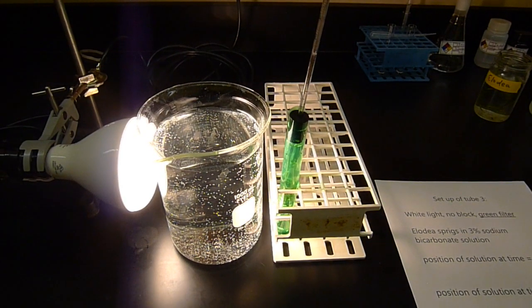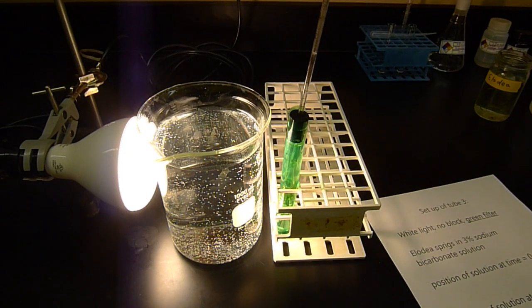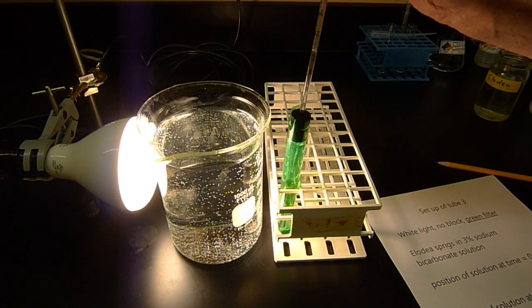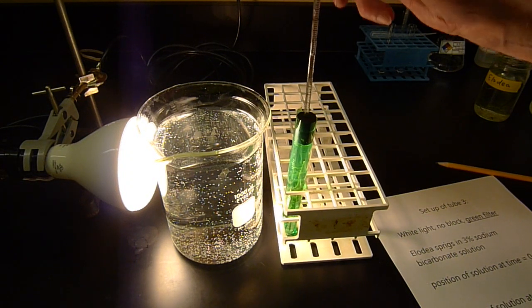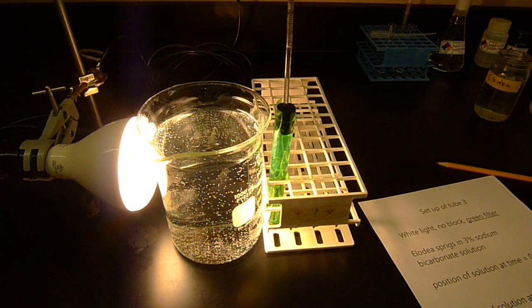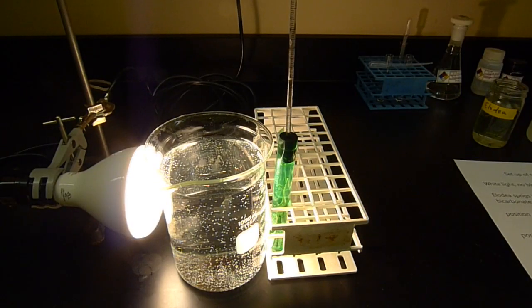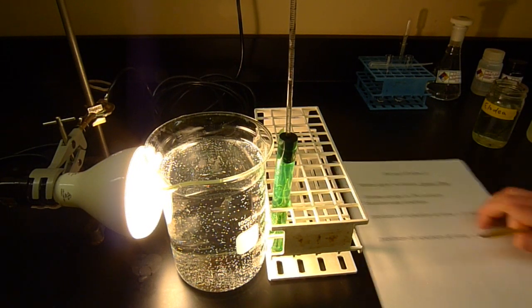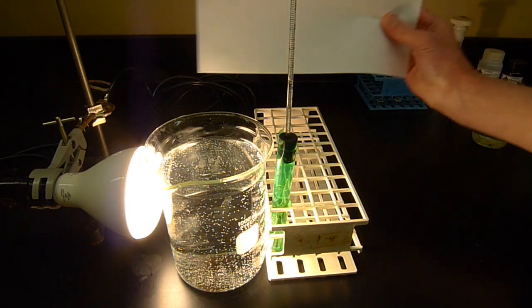The camera adjusts. And again, I'm going to record the position of the liquid in this tube. It hasn't moved yet. I'm going to wait a couple of minutes, see if it moves, come back. Or actually what I'm going to do is wait for it to get to a convenient measuring point, and then I'm going to measure it 10 minutes later, measure it again. So it looks like this stuff is starting to move a little bit. So I'm going to record the position. It's at a relatively convenient place to record.